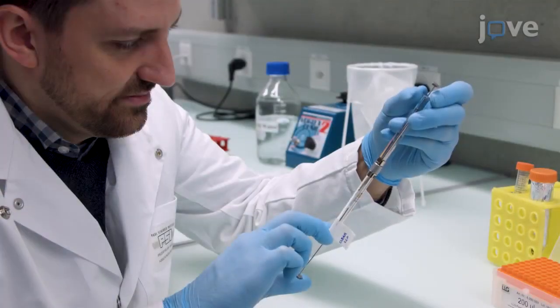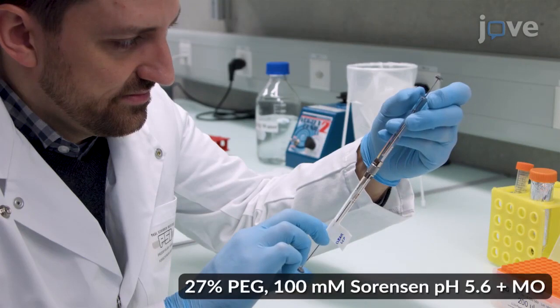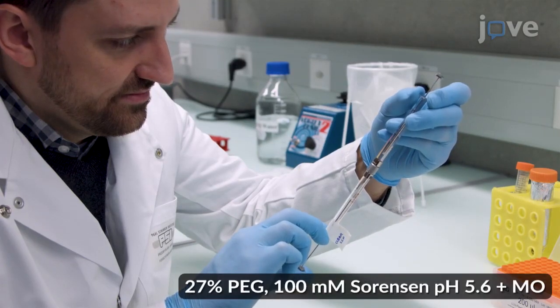Next, load 20 µL of pre-mixed LCP in another 100 µL syringe.